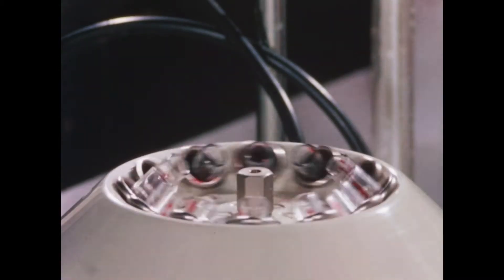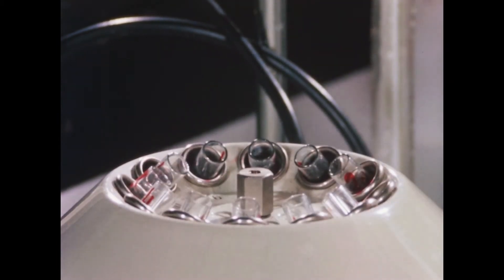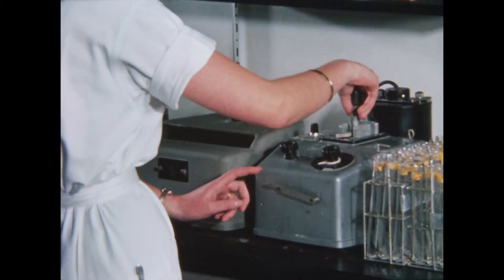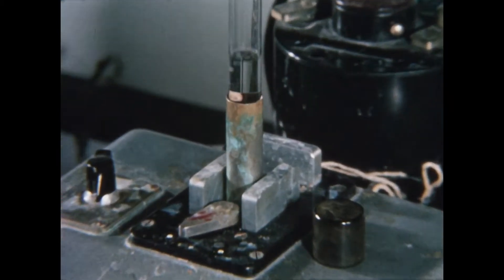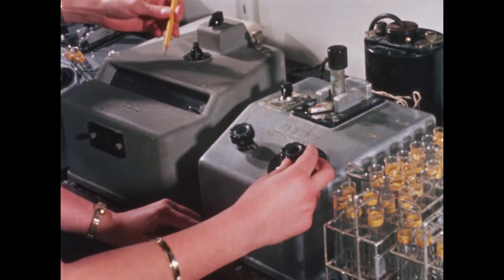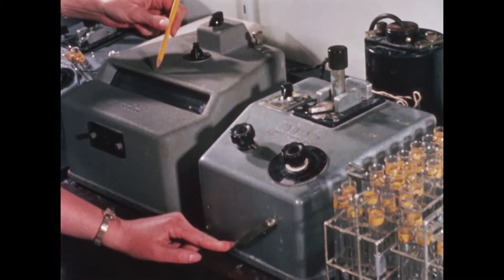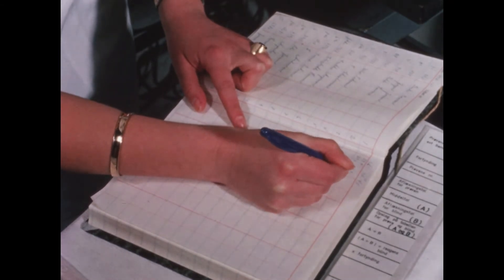The final measurement is done on the supernatant by determining the fluorescence of the specimen in a special fluorometer. The results are entered in the records whose individual columns, as elsewhere, are provided with a tally to enable the technician to enter the results and other relevant figures in the correct places. In this way, the working procedure is easy to survey and to check.